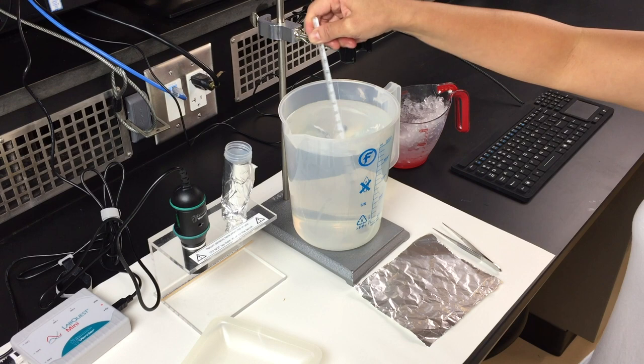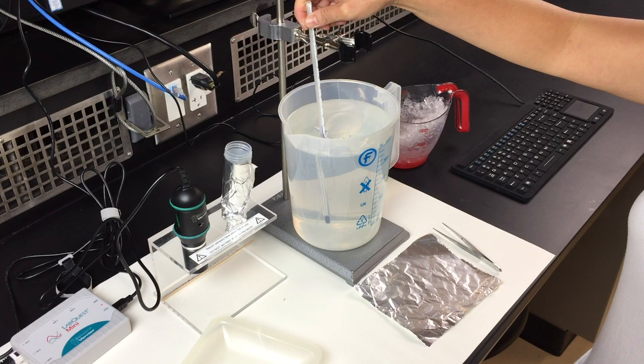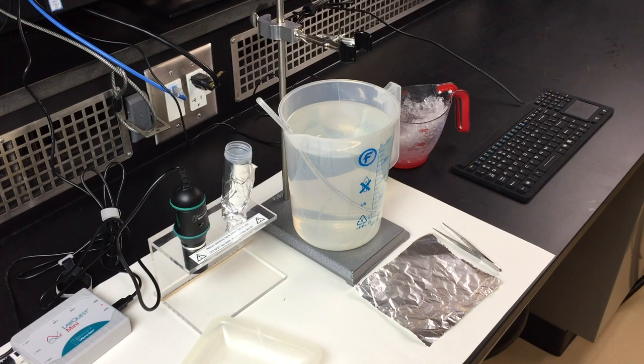Make sure that the temperature of your water bath remains relatively constant during the duration of the experiment. The first temperature of this water bath is 20 degrees Celsius. That's the temperature for the first set of the experiment.